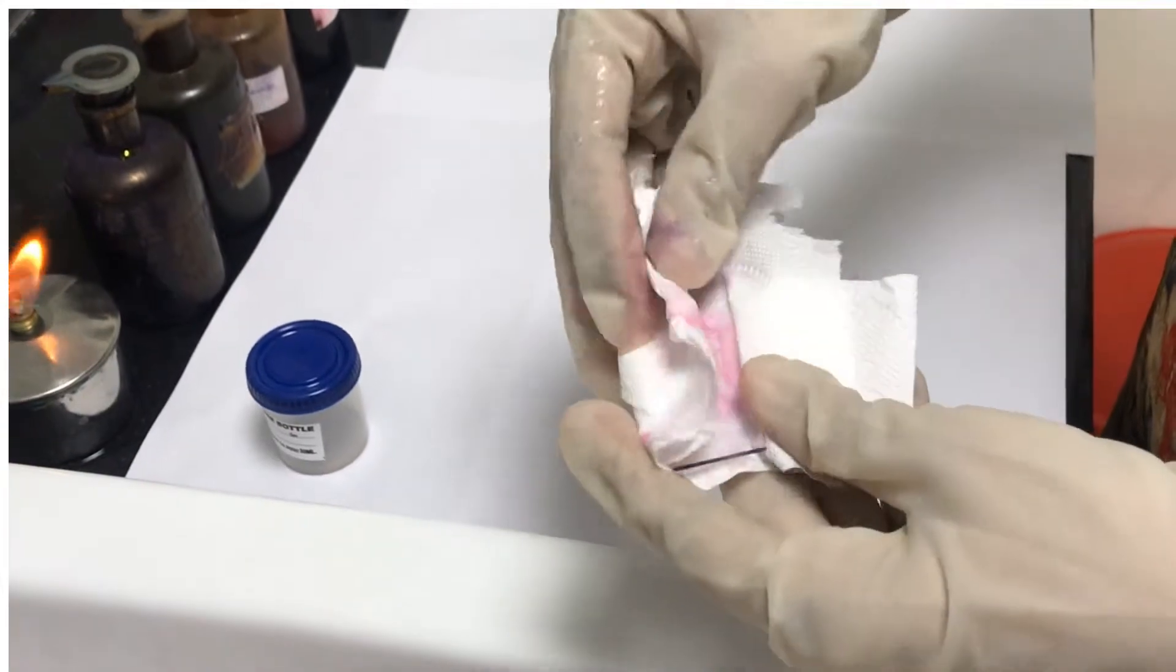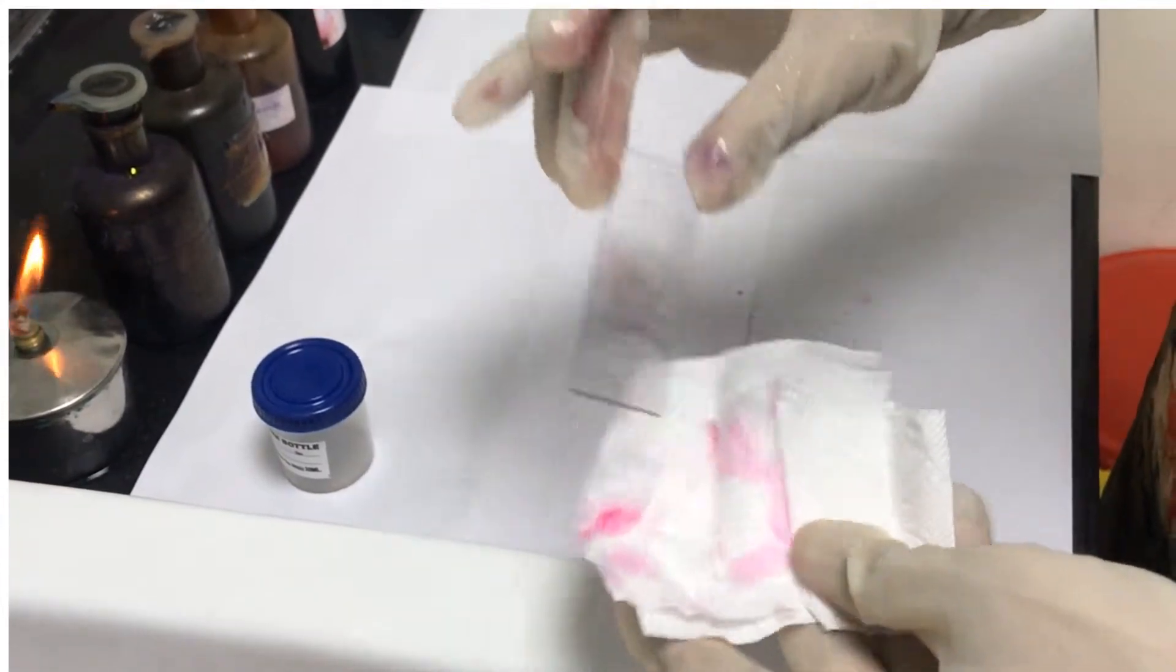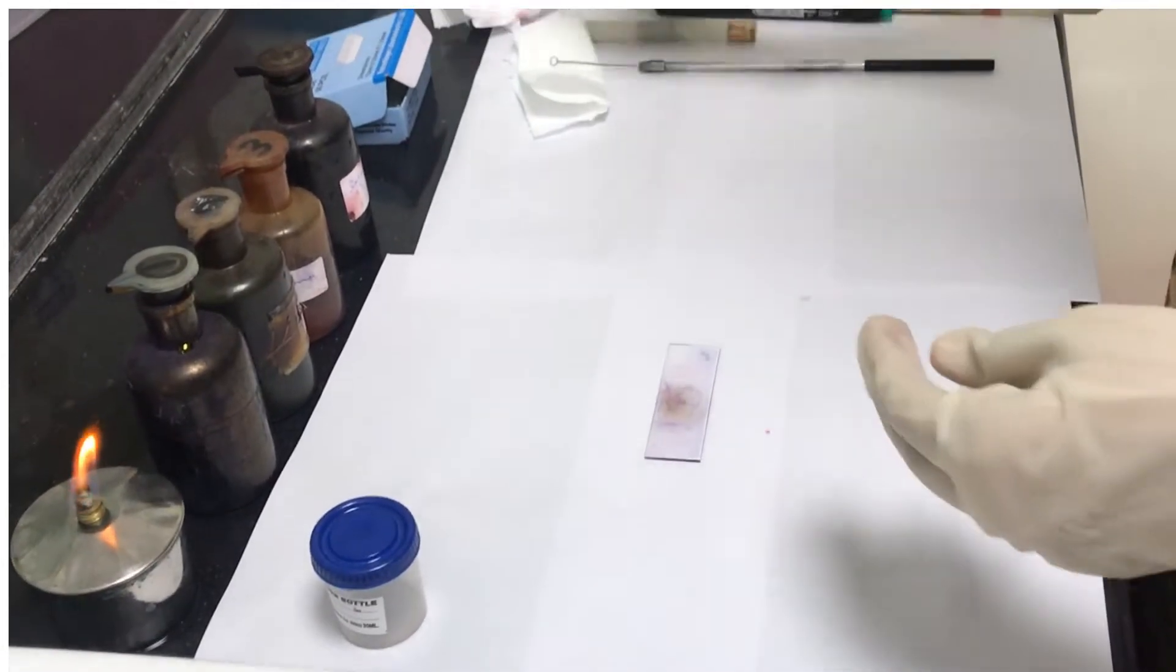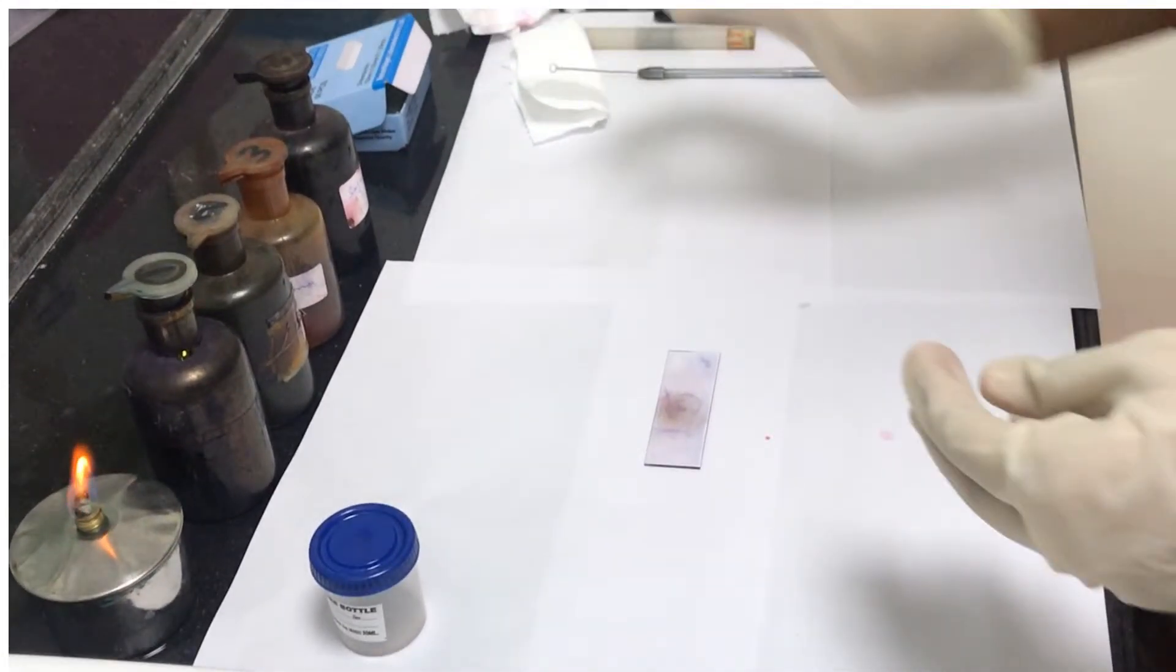Now the smear is ready to be examined. View the smear with a light microscope under oil immersion. Thank you and good luck.